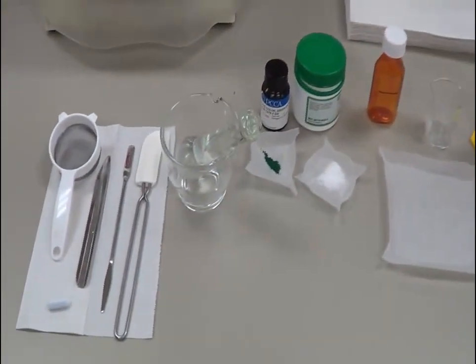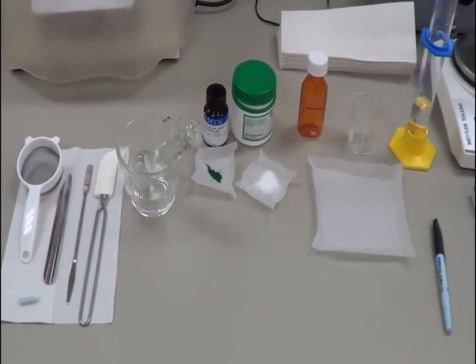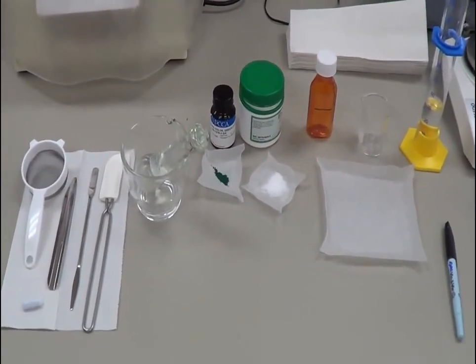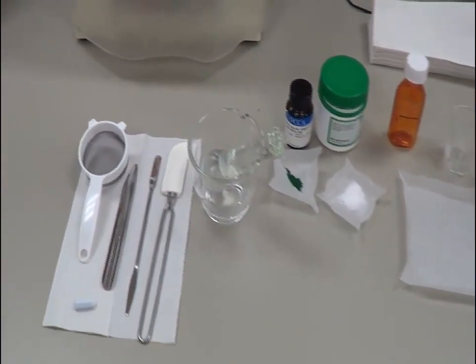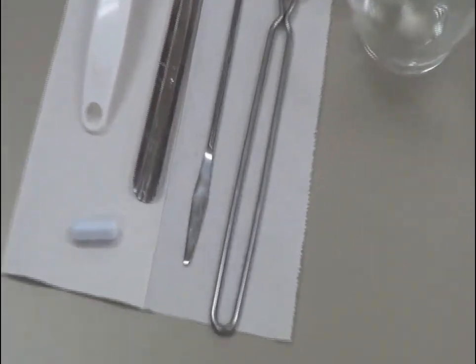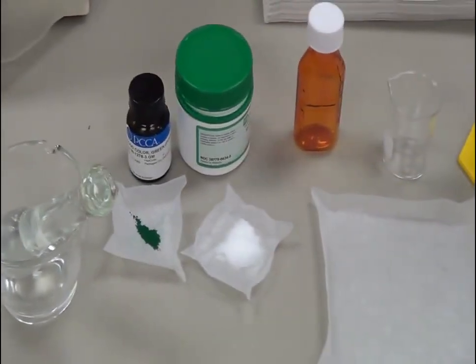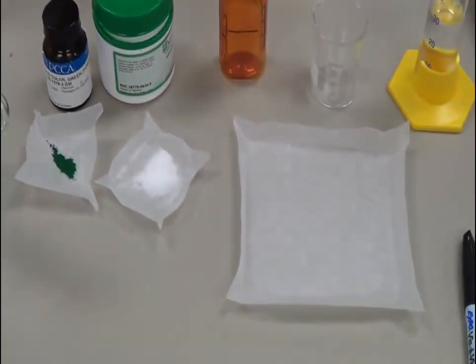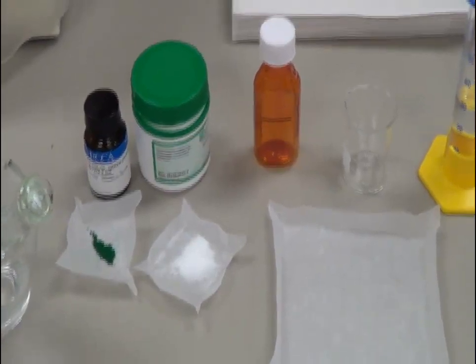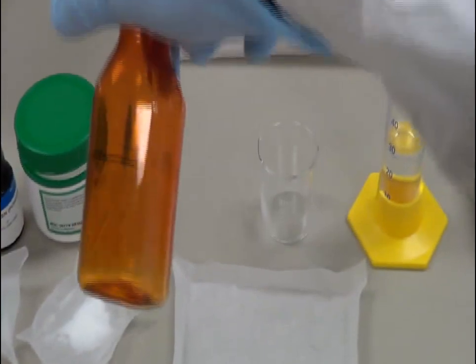Here are the following equipment and powders that I assembled. We need a sieve, spatulas, a stir bar, and a mortar and pestle. We have food color, ascorbic acid, and a bottle that is already calibrated.